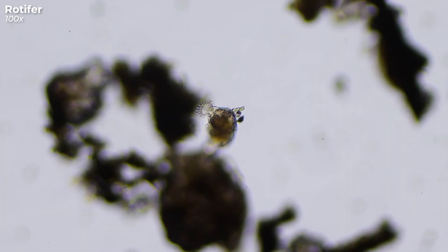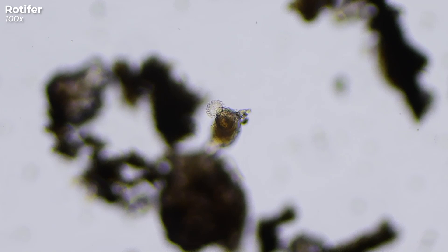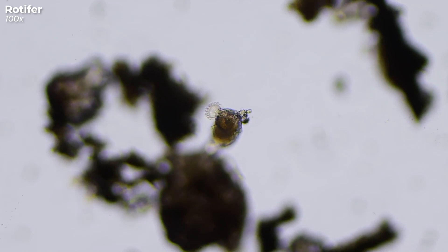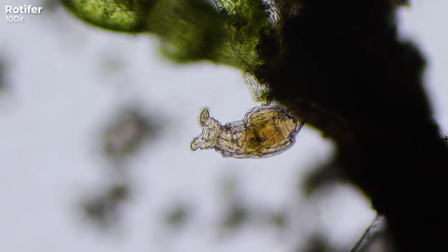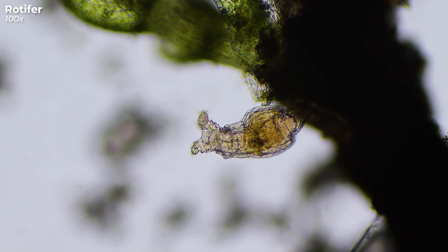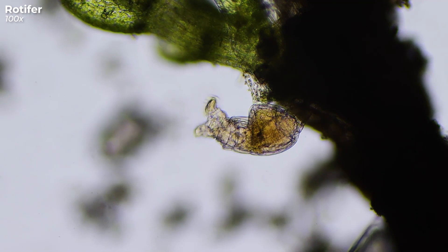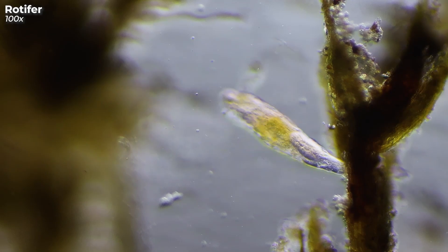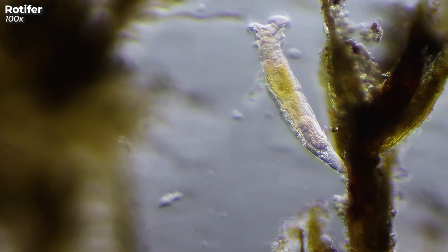Anyone who has seen my previous video on potting soil certainly knows what kind of microorganism we are dealing with here — obviously, this is a rotifer. There were plenty of them in our street moss. Here we can observe a rotifer creating a kind of vortex using its rotating, wheel-like ring of cilia on its head, and by doing so it swirls tiny food particles towards itself. Also typical of rotifers is the clearly visible, rhythmically contracting gizzard. On its foot it has toes, equipped with adhesive glands that allow the rotifer to attach itself to a substrate — here it has attached itself to a small piece of moss.